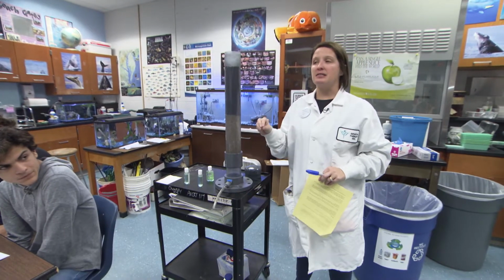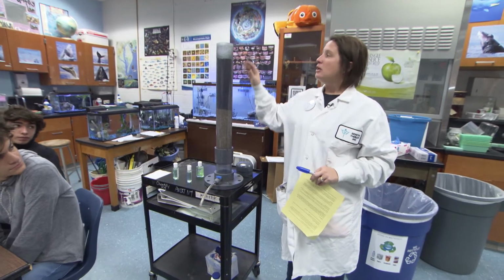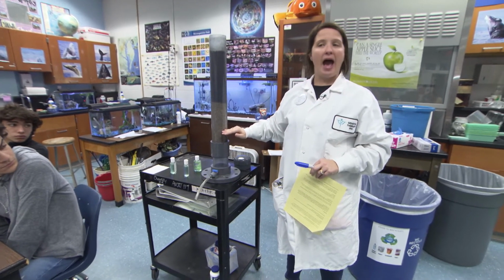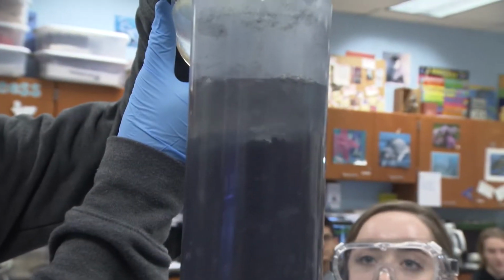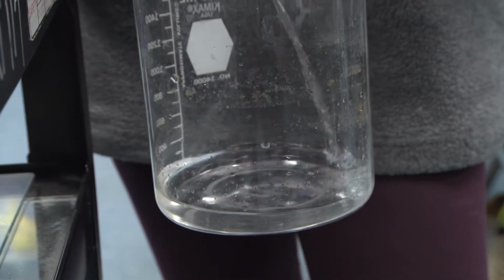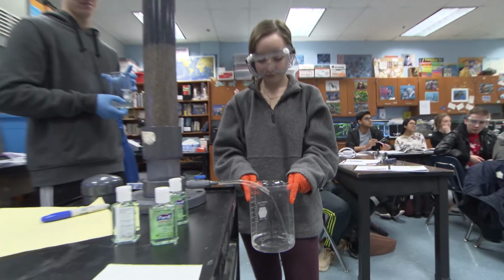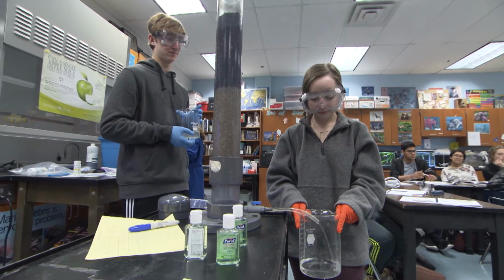Our last step is for the water to pass through a filtering system. So you guys can see that there is a charcoal layer and a sand layer in the filter. Once the 10-minute contact time for the bleach and discussions of careers in the water industry are complete, it is time to filter the water through a carbon sand filter. The carbon will capture any remaining large particles and the sand will capture any remaining fine particles. This filter does a remarkable job of taking out both particles and color.